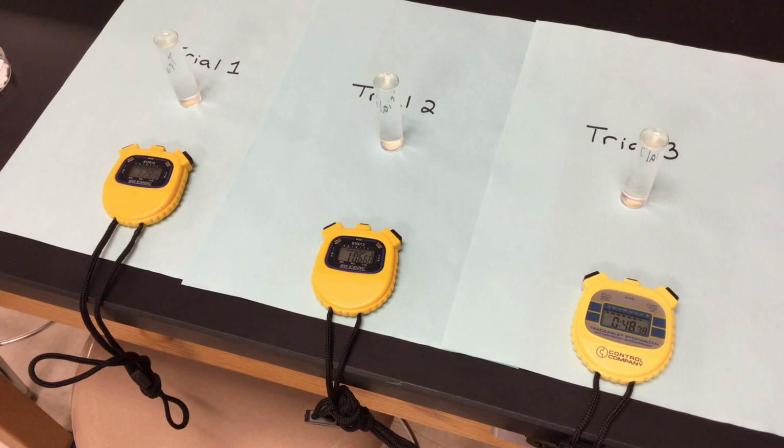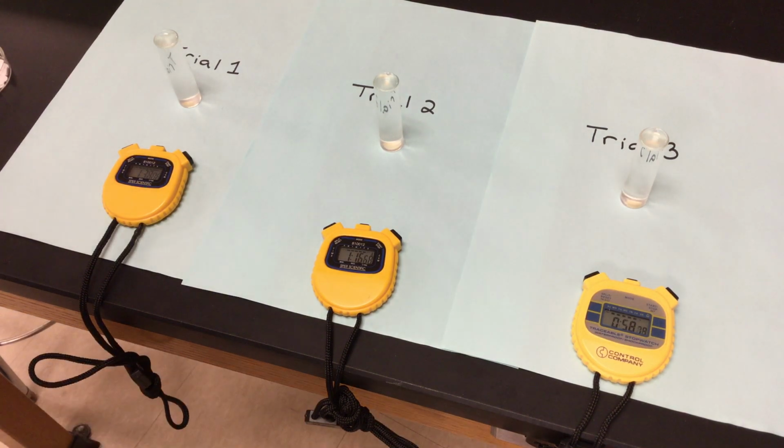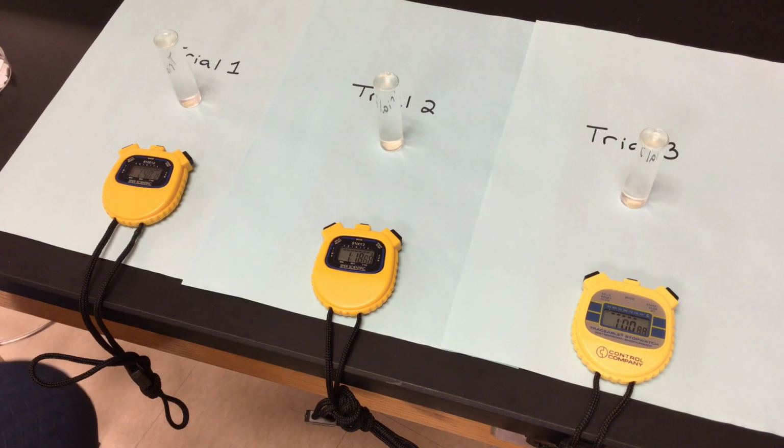And we're waiting for those discs to float to the top. Now remember, the discs would be floating to the top because my hydrogen peroxide, which we know is in each one of those tubes with a pH of 3, would be broken down into water and oxygen. And what would be happening, that enzyme, that catalase, as it's breaking down hydrogen peroxide, those little oxygen bubbles would be trapped on that disc and would be forcing it up to the top. So it's going to float up to the top, hopefully.